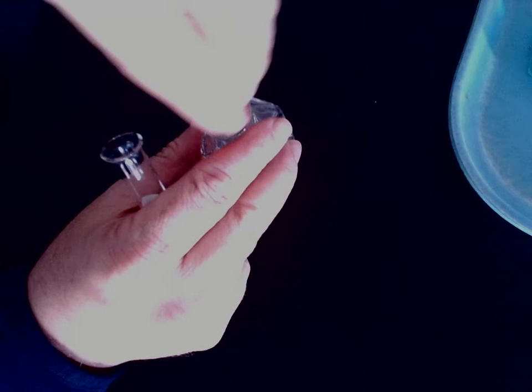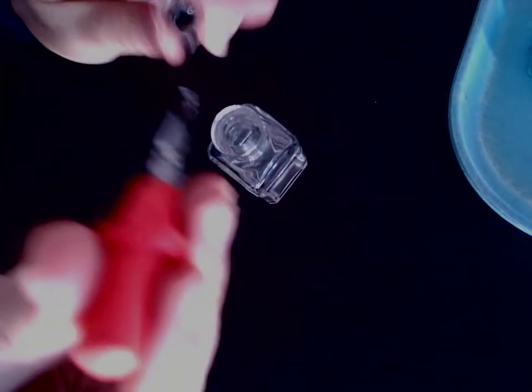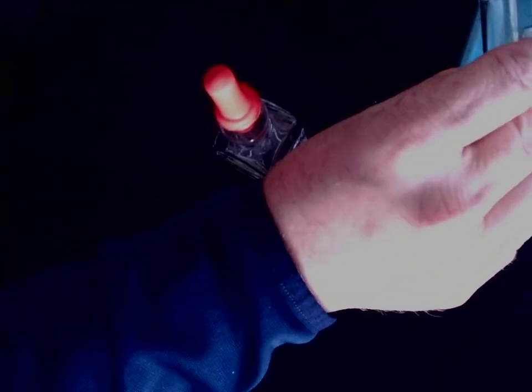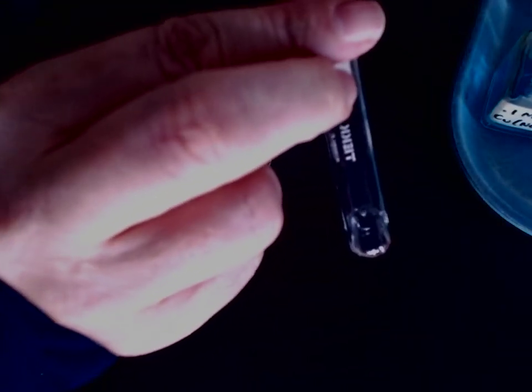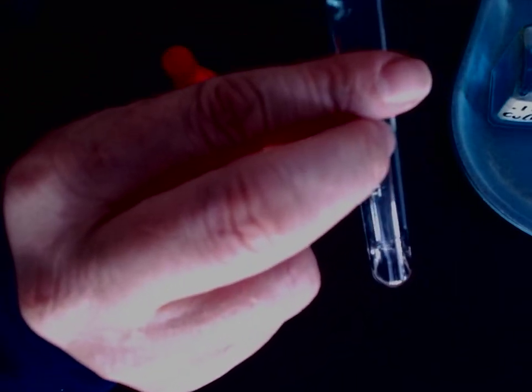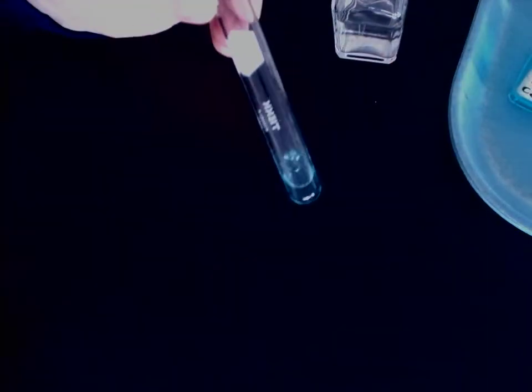The next row we're going to be working with is sodium chloride. So, sodium chloride — the first thing we're going to be doing is mixing with copper nitrate. There's the sodium chloride, here comes the copper nitrate — there you go.